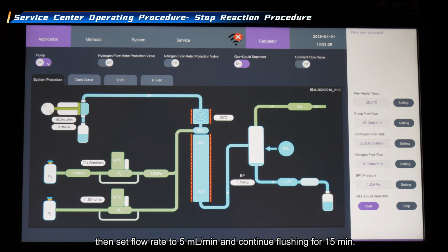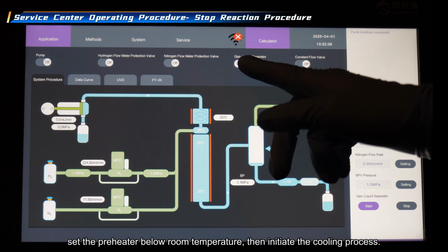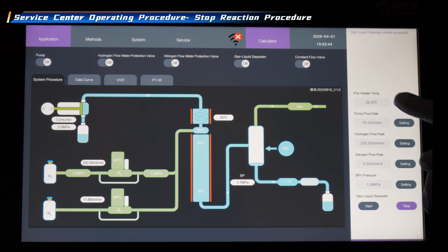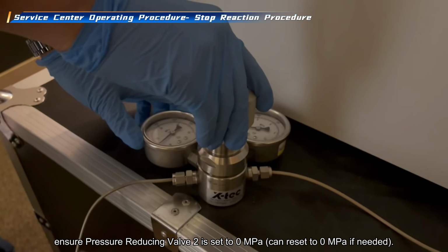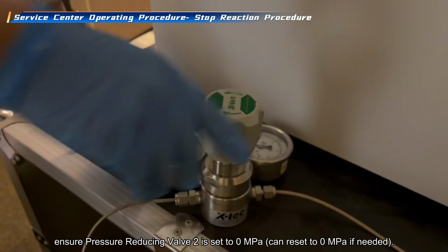Then set flow rate to 5 milliliters per minute and continue flushing for 15 minutes. If the flow rate is 5 milliliters per minute or higher, flush directly for 20 minutes. Shut down the pump and gas liquid separator first. Set the preheater below room temperature, then initiate the cooling process. When the temperature drops below 60 C, ensure pressure reducing valve 2 is set to 0 megapascal. Can reset to 0 megapascal if needed.